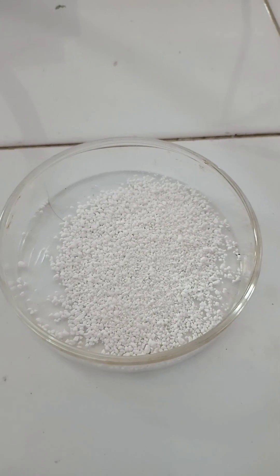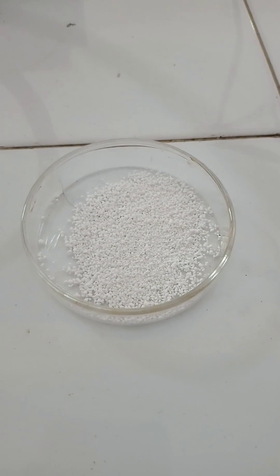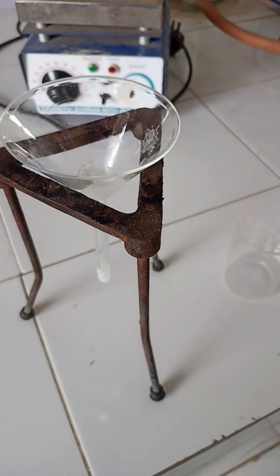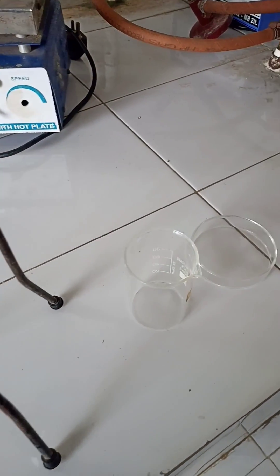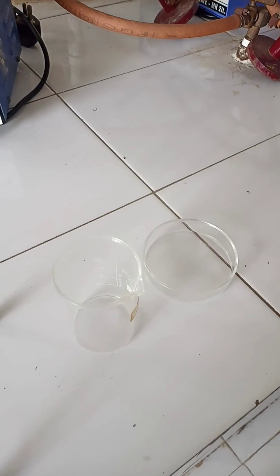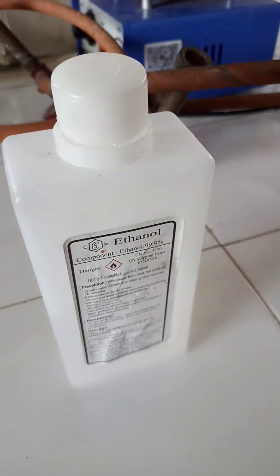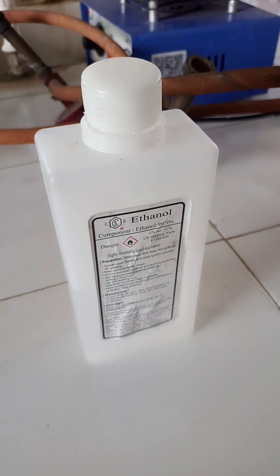Recrystallization of Phenyl Benzoate using the apparatus: funnel, beaker, Petri dish, and solvent as ethanol.